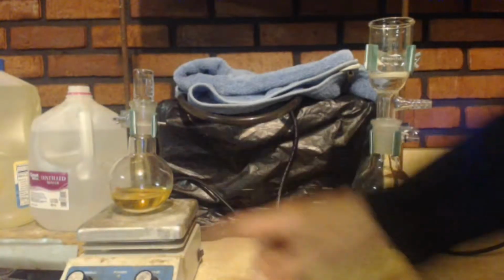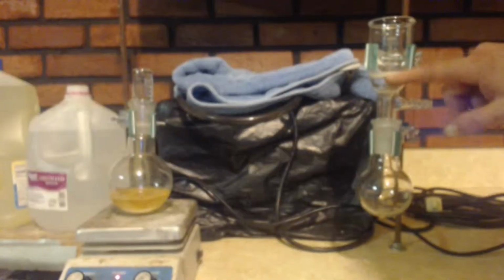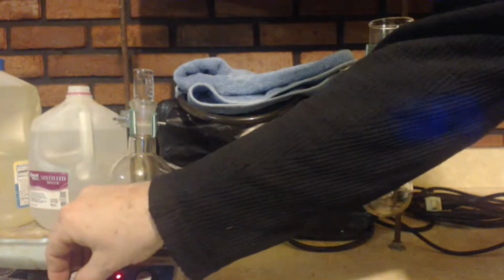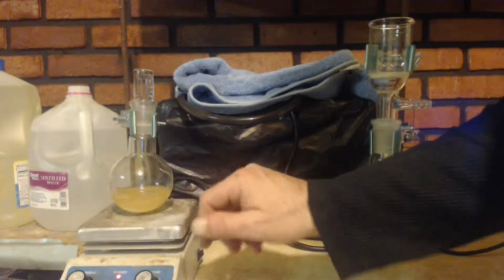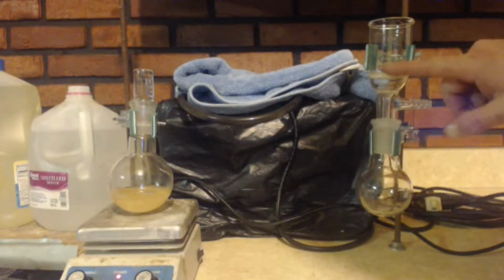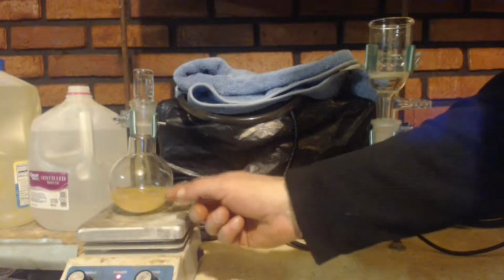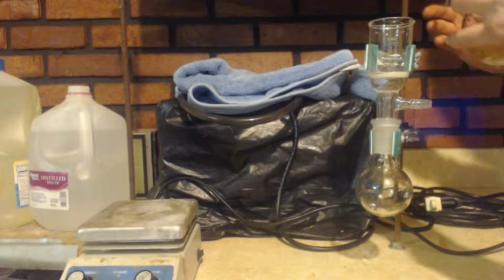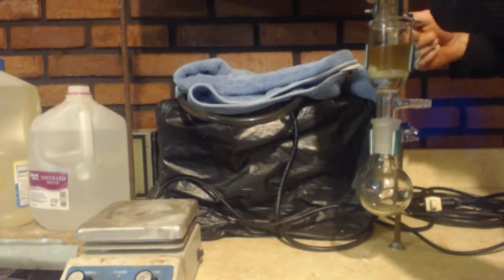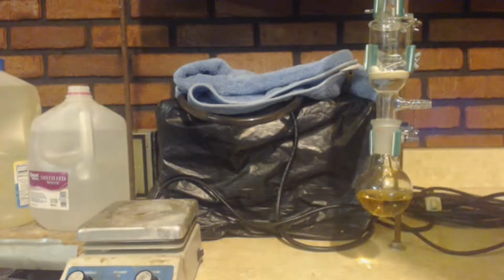You can see it's still yellow, still clear. I'm going to filter it just a little bit before I put it into this fritted funnel here. The reason why is because the liquid is thick and it sticks to the salt. And if I put it in here, I can put the vacuum pump on it, and it'll suck the salt dry instead of leaving a lot of my product caked in there, right? And I'm just going to pour it right in here. And there you go. Now I can distill it.